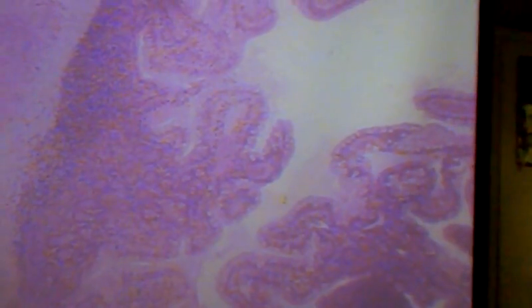But any region of very densely packed, dark staining cellular material in the mucosa is going to be that MALT, lymphatic tissue. And what you'll see is that the further down the GI tract we get, the more of it you will see. The reason is that as the food progresses down the GI tract, the bacterial population multiplies until in the colon, a large percentage of the mass of what's left in the colon is bacteria and fiber, undigestibles, essentially.